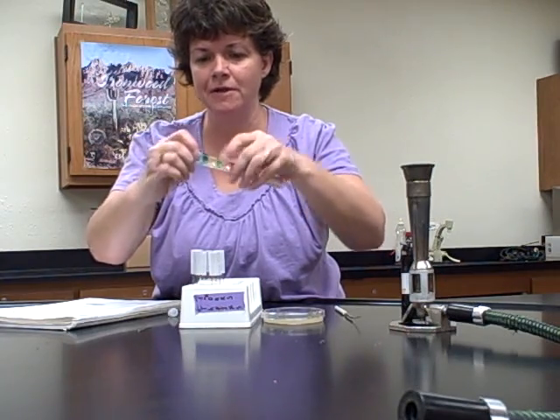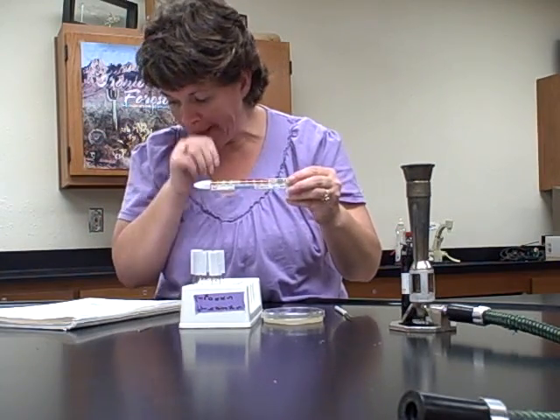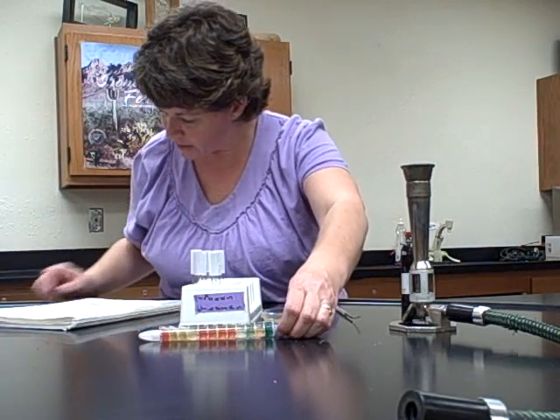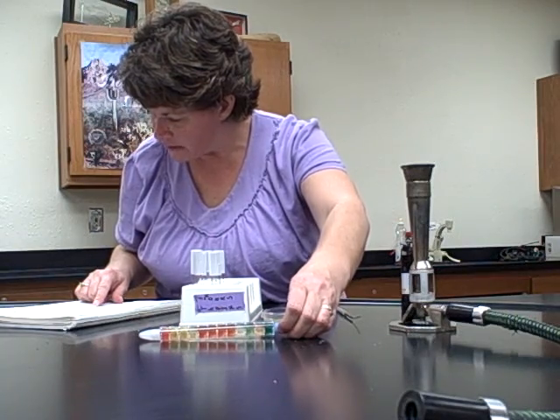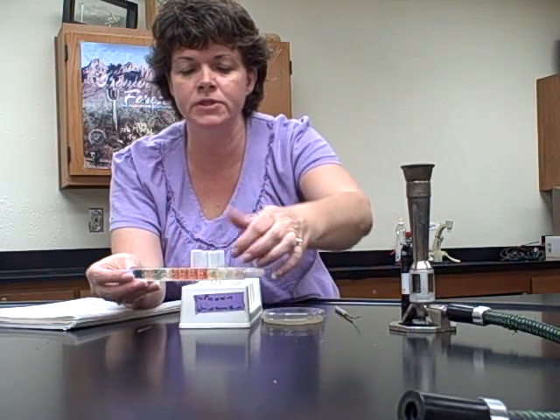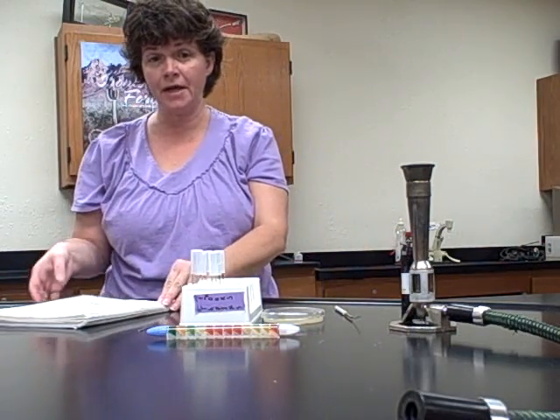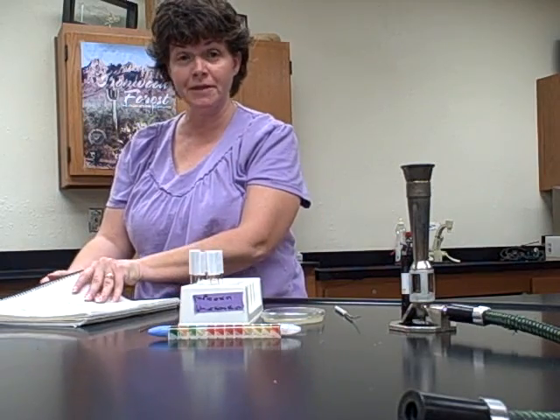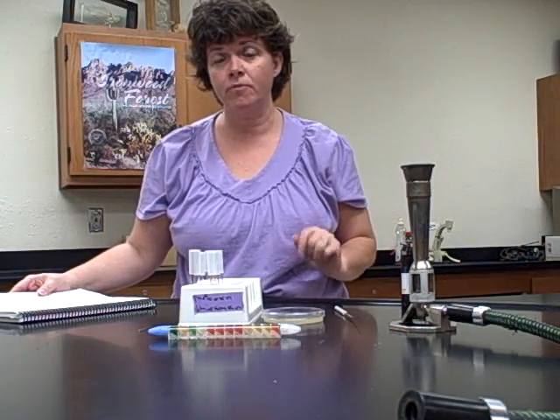Then you're going to put your lids on both sides. Okay, and then you're going to put it in the incubator. Go ahead and label it with your group name, and then you put it in the incubator. Let's see. You probably set it like that in the incubator. Okay, so you have the little notches that you've poked the holes in. Label it with your number and your group name, and set it in the incubator. Okay, you don't want to stack them on top of each other. So you'll have the 4 tubes you inoculated plus this, and then you would have already done that oxidase test. Okay, so that's the procedure for the rapid ID methods.